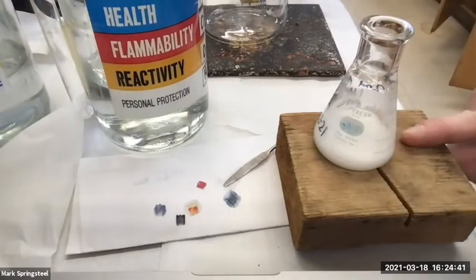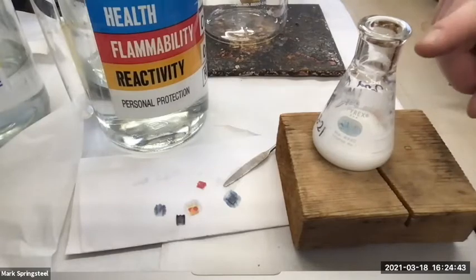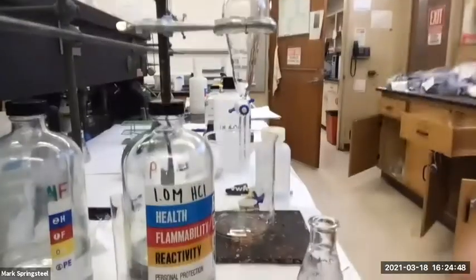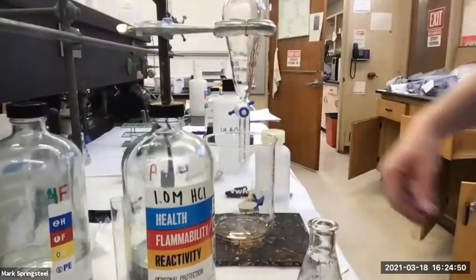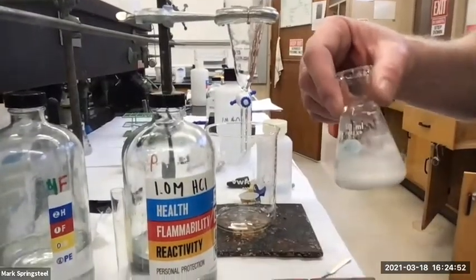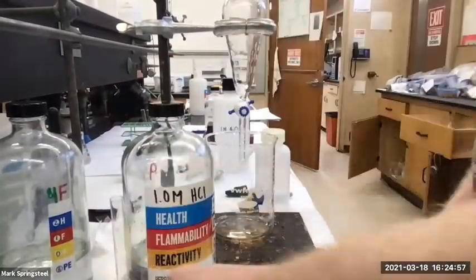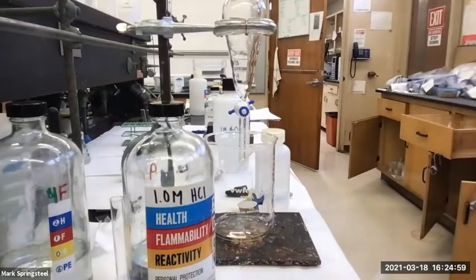So it would have been a lot more water in there. And this acid is a little bit water soluble. So if I add a lot of water, when I try to recover it, it's not going to be as high of a yield. So that's why I use the 6 molar. All right, that's nice, huh? Got our first layer precipitated out. Let's now write down what we did there. Make sure we don't lose track of what's going on.